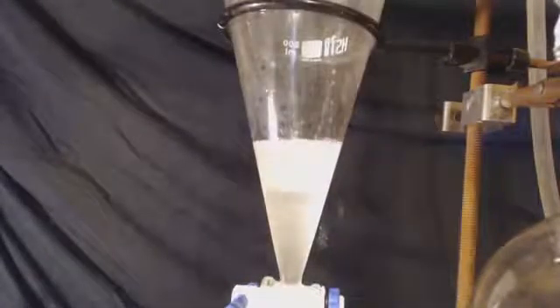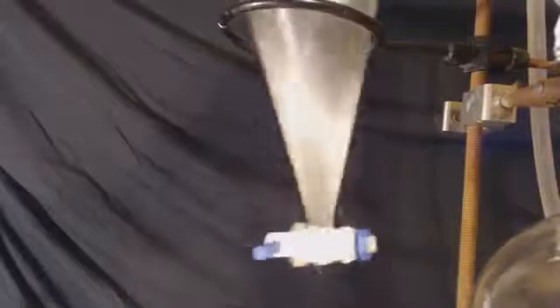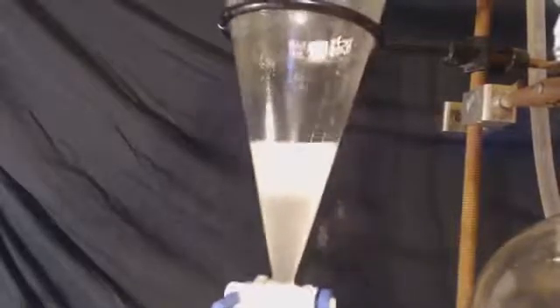So I'm going to throw everything from the receiving flask into this separating funnel. I'm going to add some, clean out the round bottom flask it was in with some really ice-cold water. I'll shake that up, let it sit for about 10, 15, 20 minutes, let it separate out. I'm going to take out the bottom layer, which is what I want. The top layer, I'm not going to have to worry about it, it's just going to be discarded, that's just garbage. It'll be like your ethanol, water, any sulfuric acid that came over.